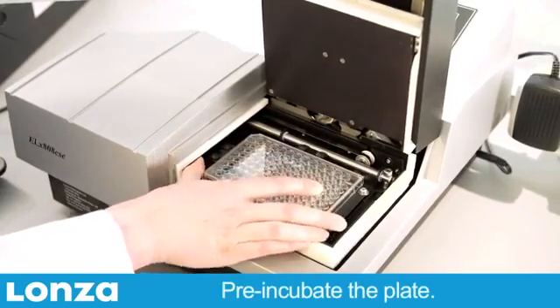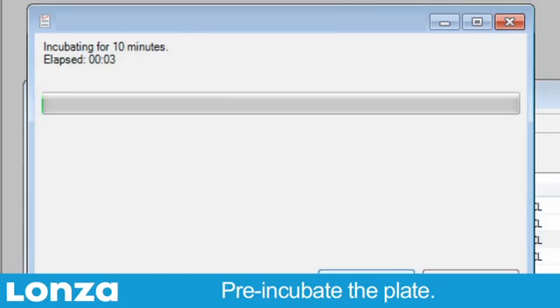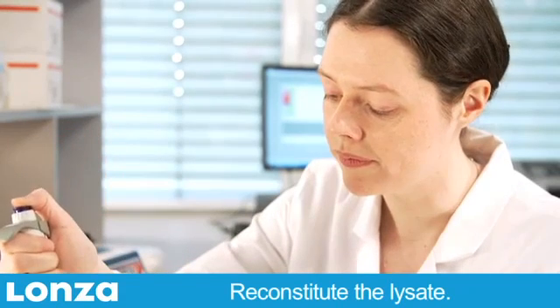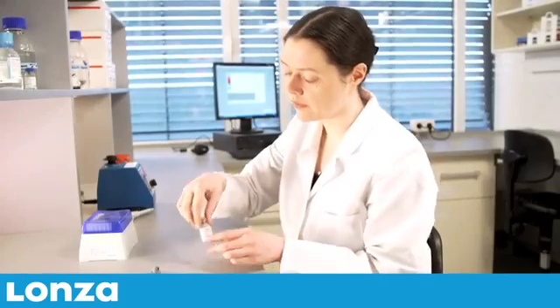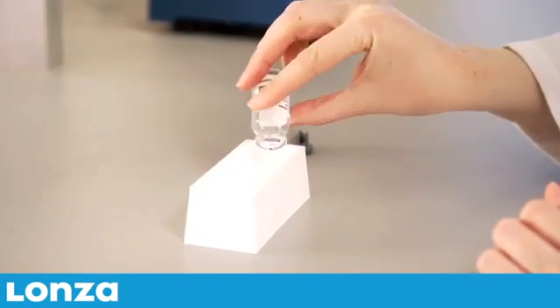Pre-incubate the plate for at least 10 minutes at 37 degrees Celsius. During the incubation period, reconstitute the lysate with the appropriate amount of reconstitution buffer and mix gently but thoroughly. Allow bubbles to clear. Pour the reconstituted reagent into a reagent reservoir.